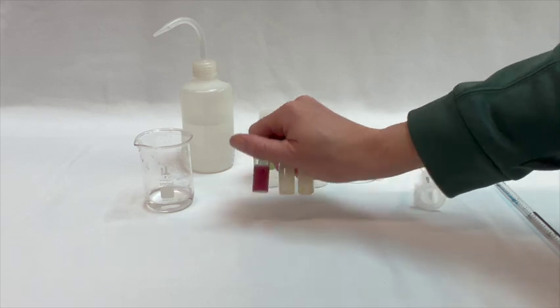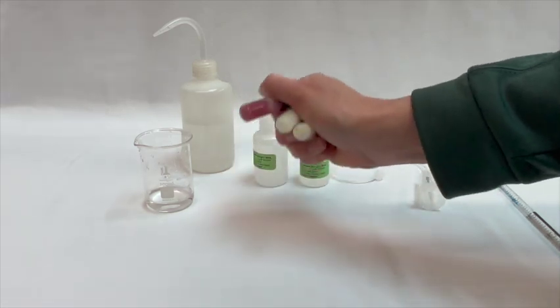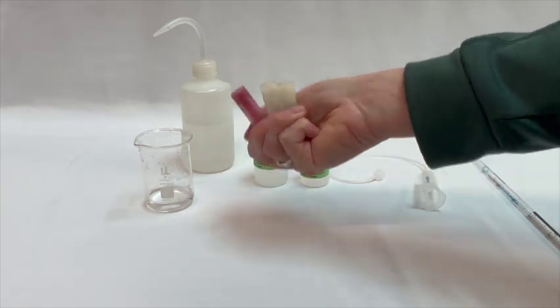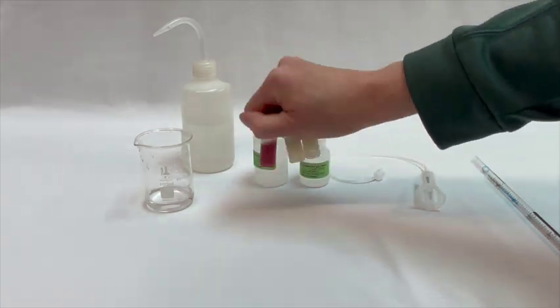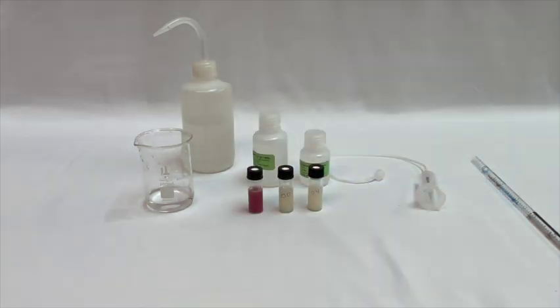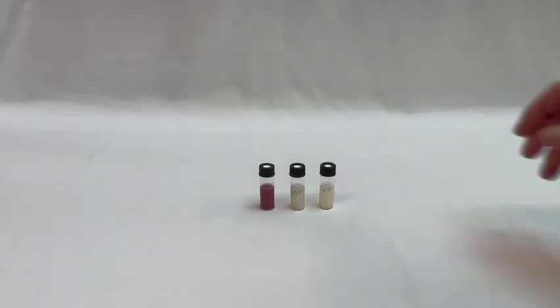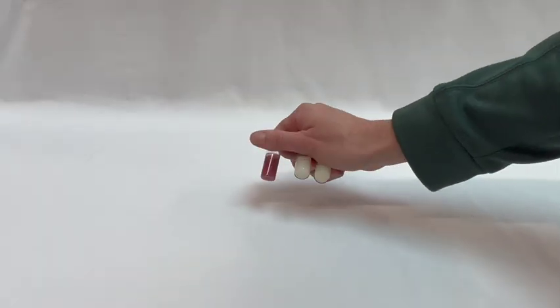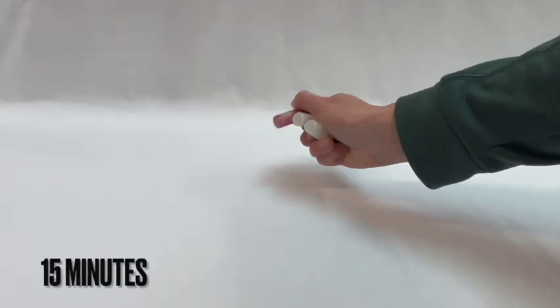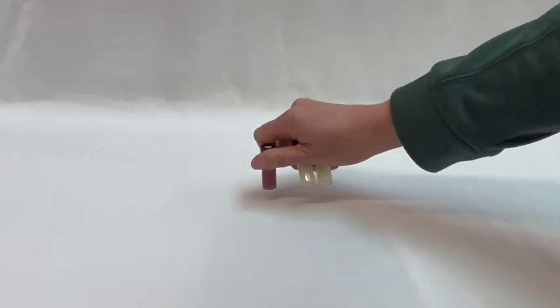After you have filled all of your vials, give them all another good shake for approximately 10 seconds. Now allow the samples to incubate at room temperature for 45 minutes total, but make sure to give them a shake at the 15 and the 30 minute mark.